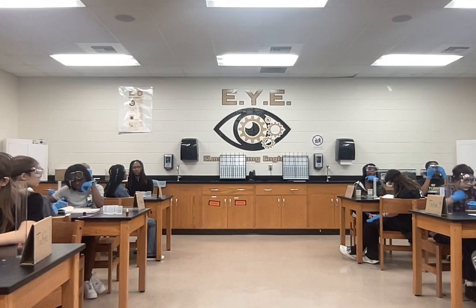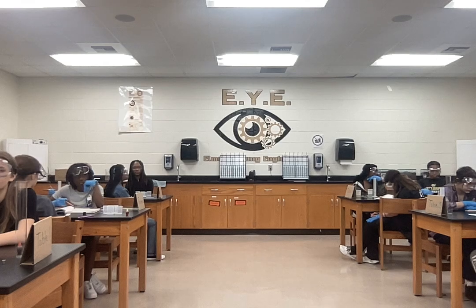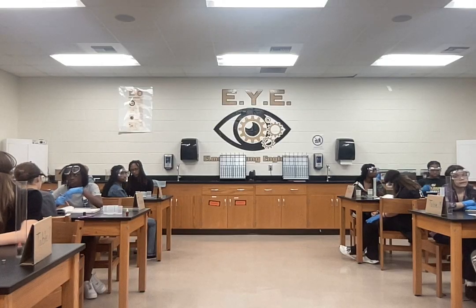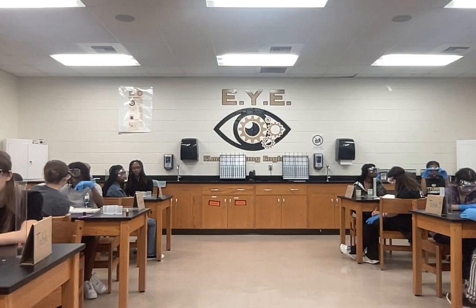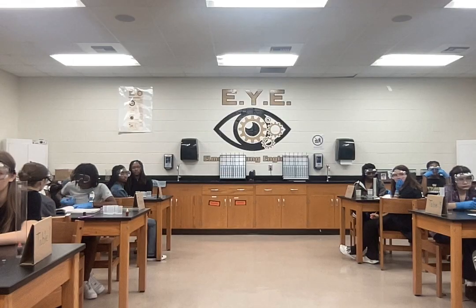Alright, Tanner, did you get that? The first one is 1.5832. Okay, so the density at 25 milliliters, 1.5832. So let's just do 1.58. Alright, and then Tanner, the next one? What was that? 1.25. So for the second one, it's 1.25. So those numbers are still relatively close to one another, okay?